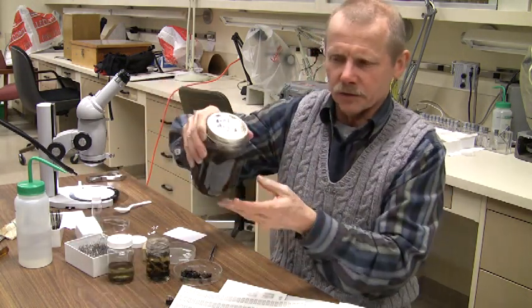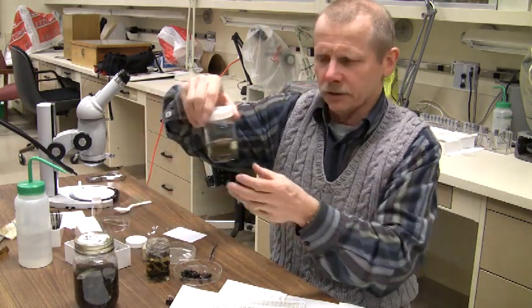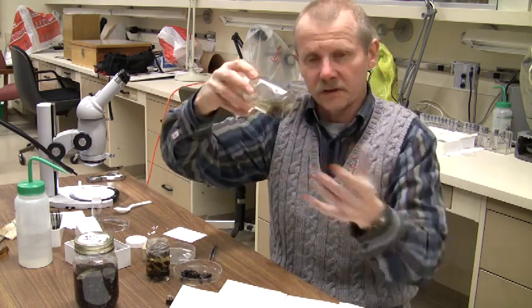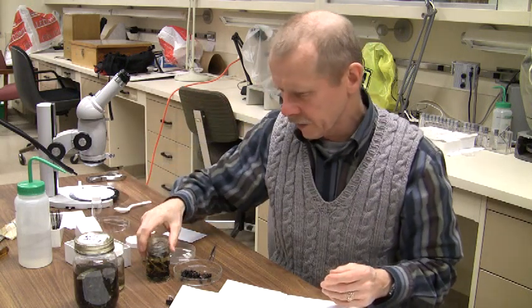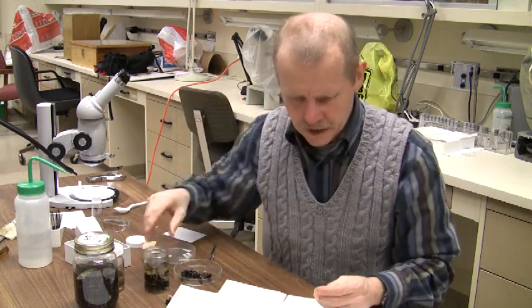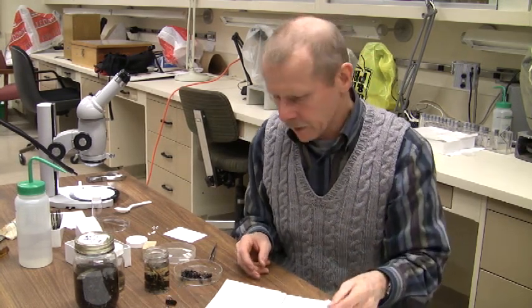You'll have a large jar which contains the medium-sized insects, and another jar or bottle with very small insects. We've sieved these samples to divide them into the coarse and the fine fractions. Then you'll have another jar with some larger insects already pulled out. You're going to sort through these collections to select specimens for your individual collection.